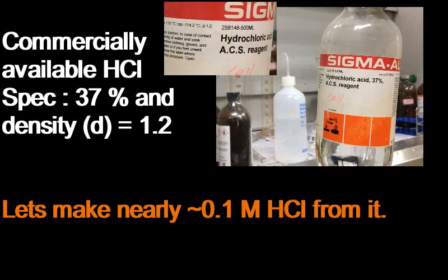The commercially available hydrochloric acid is a very concentrated hydrochloric acid solution. In the bottle, we can see that it is labeled with 37% and the density D is given as 1.2. From this concentrated hydrochloric acid, we need to prepare dilute hydrochloric acid of around 0.1 molar concentration.